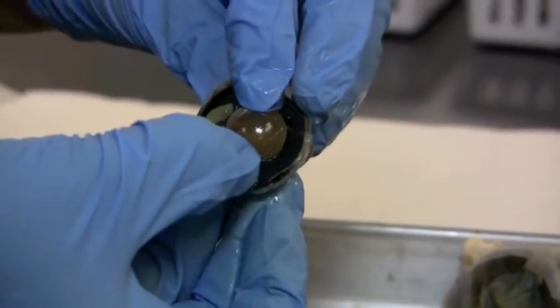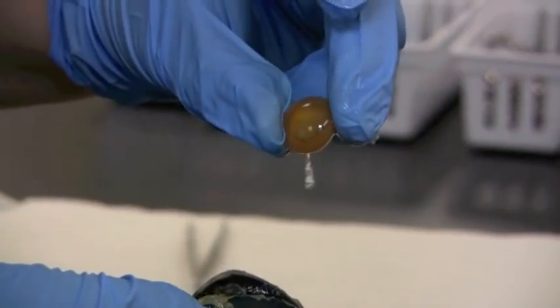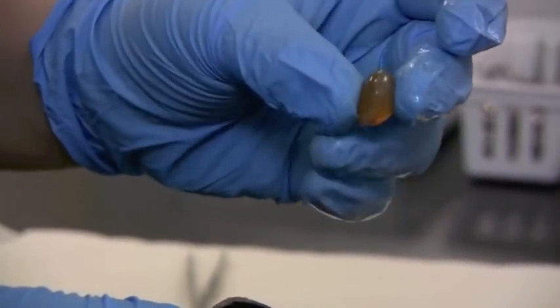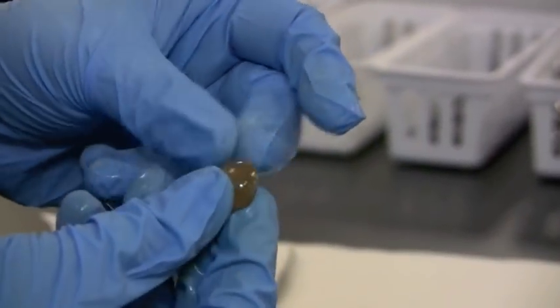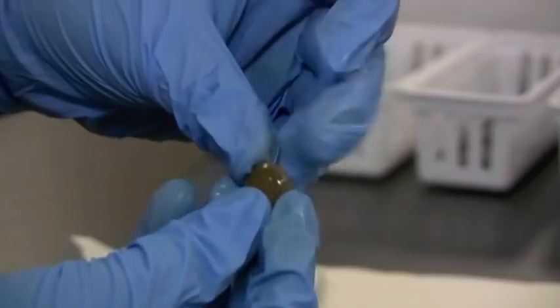Doesn't quite look like this in real life again. It would have been nice and clear. This lens is pretty slippery. I've already dropped it a couple of times, but it's coated with that jelly stuff right now. But it's very hard. I'm pressing really hard. It's like a marble. It's that hard.